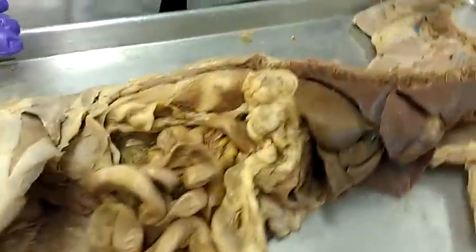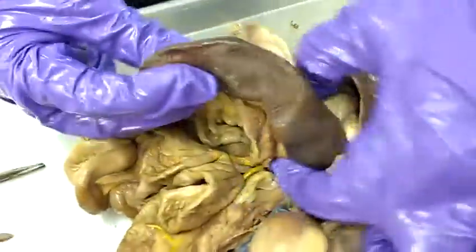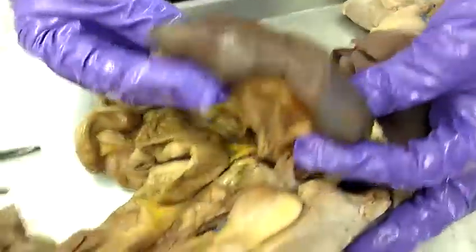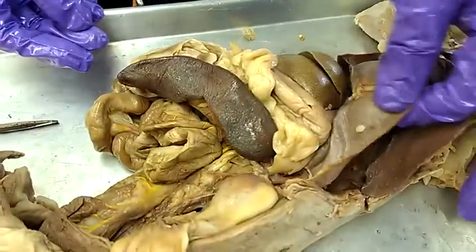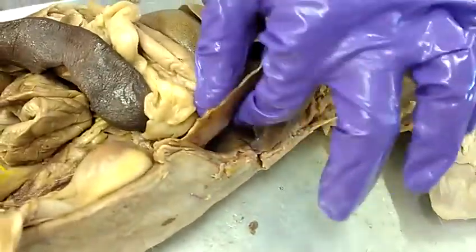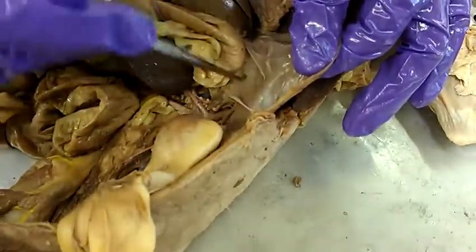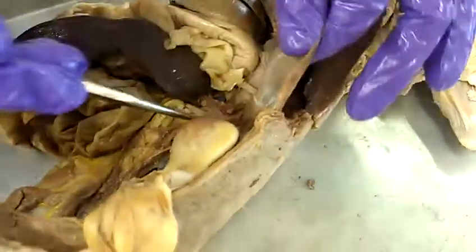Now we have to do the spleen — and there it is. It's linear on a cat, whereas on a human it's very round, but they're the same color. And that is the diaphragm.